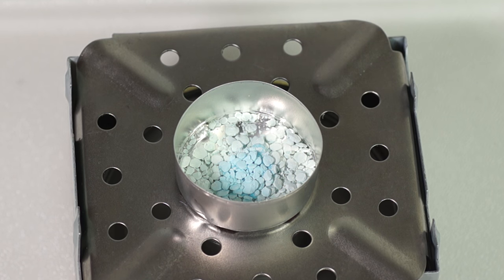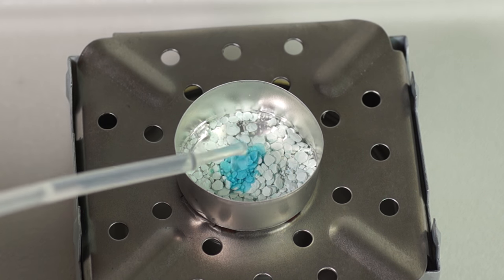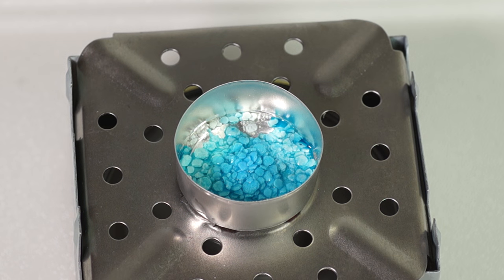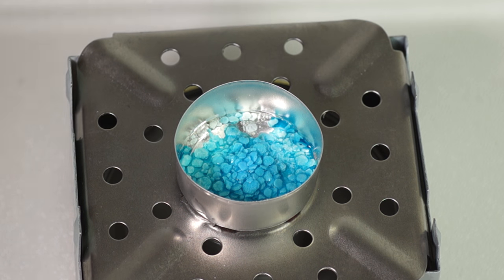If you add water to this copper sulfate, the blue color will return, and the water rejoins the molecule of copper sulfate, forming crystalline hydrate.